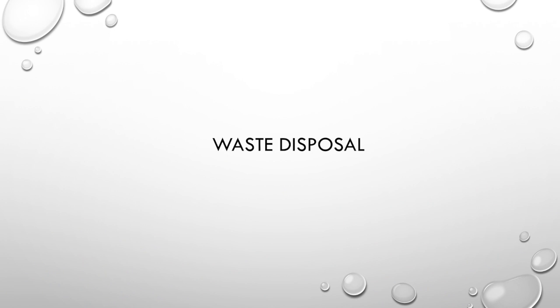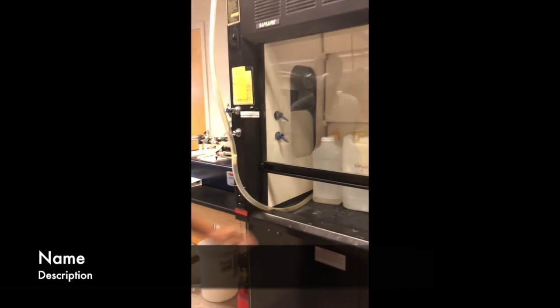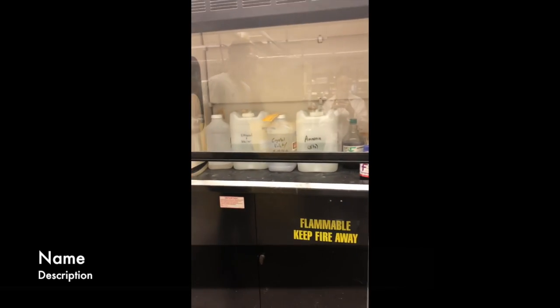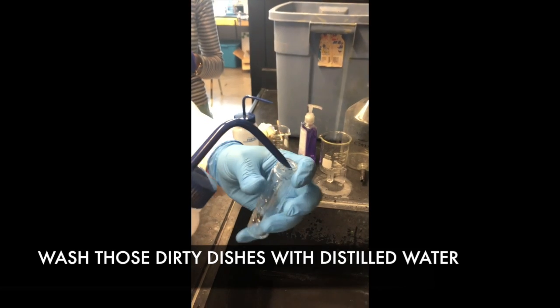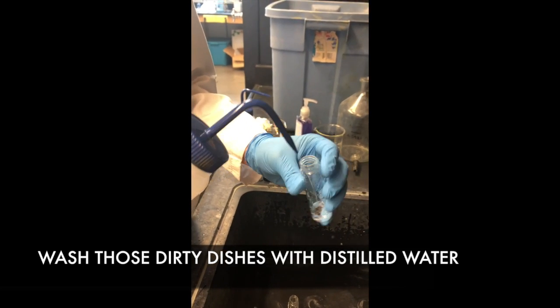After you've completed your experiment, it is important to dispose of everything properly. Here we have the disposal unit for ethanol. It's kept under the fume hood, and shut the fume hood once the ethanol is put in the container. Water can be disposed of in the sink. Also, don't forget to clean all your equipment using distilled water.